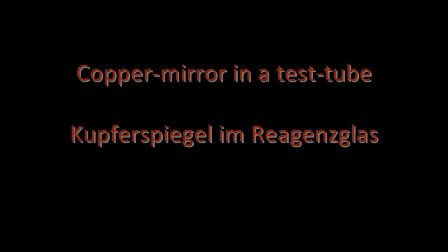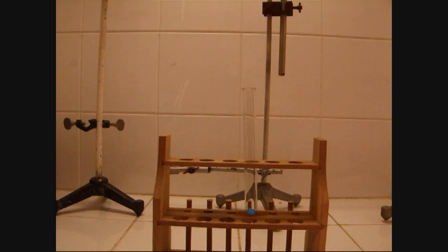Hello and welcome to another chemistry video, this time showing how to make a copper mirror out of copper sulfate and hydrazine.